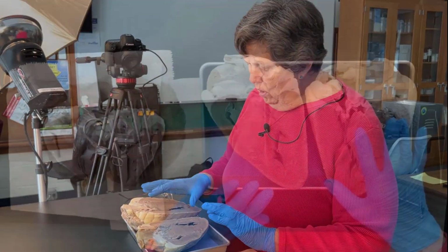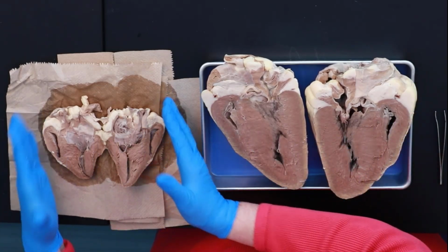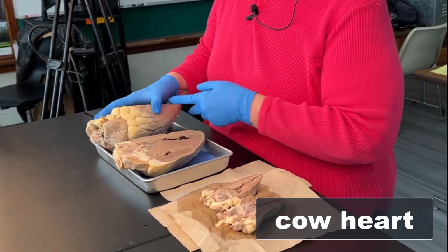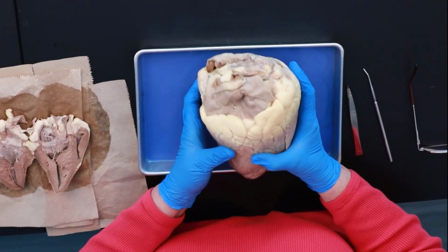So I have a couple hearts here. I have a cow's heart and I have a sheep's heart. So we'll start with the bigger heart and then we'll go to the little heart. But this is a full-grown cow's heart. And we want to look at some of the outer features.